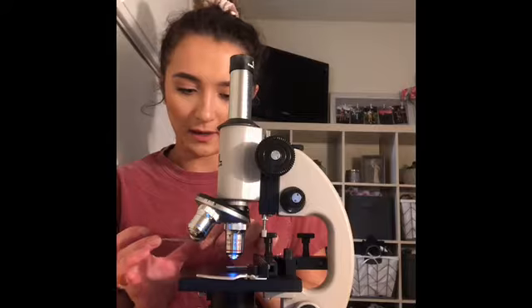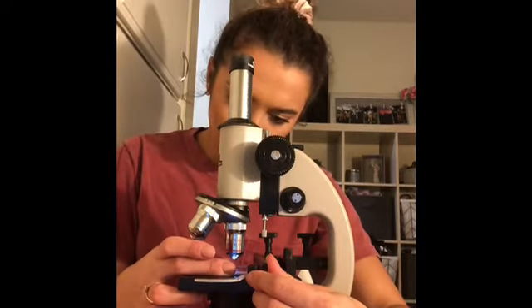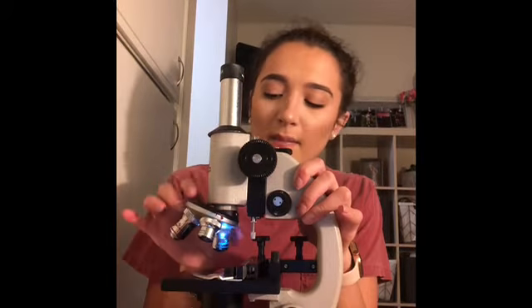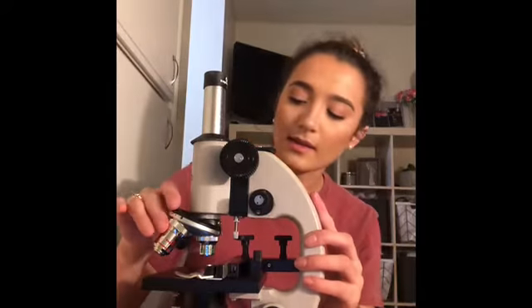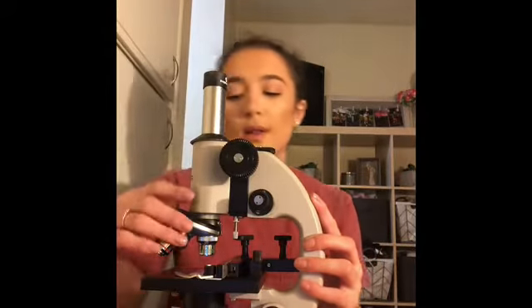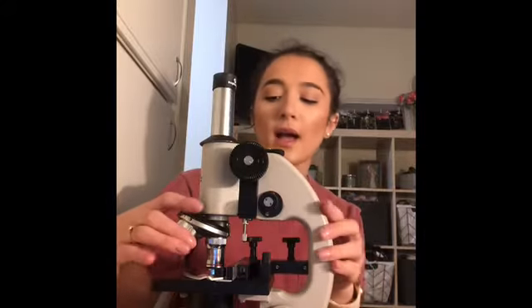And put it back onto the microscope. I use that to look at the Penicillium slide that I put on the microscope. I have found the Penicillium with the scanning lens. Now I'm going to switch to the low power lens. Okay, so I found the Penicillium with the high power lens.